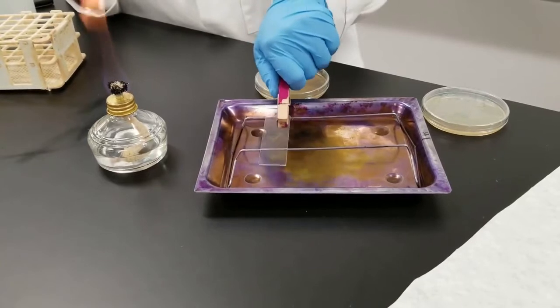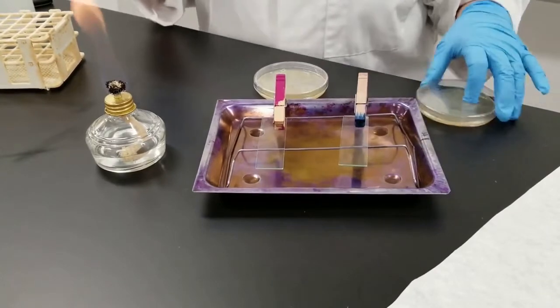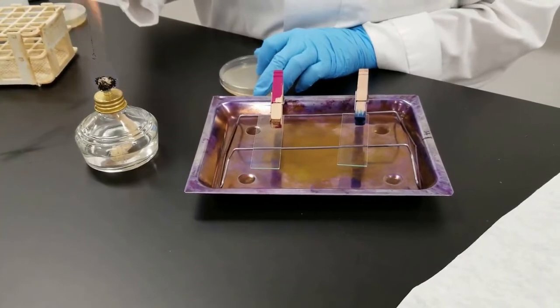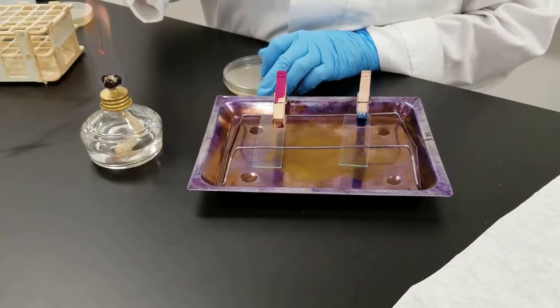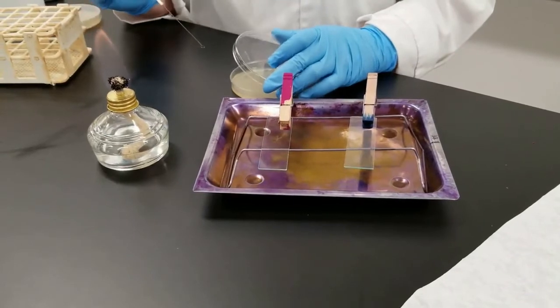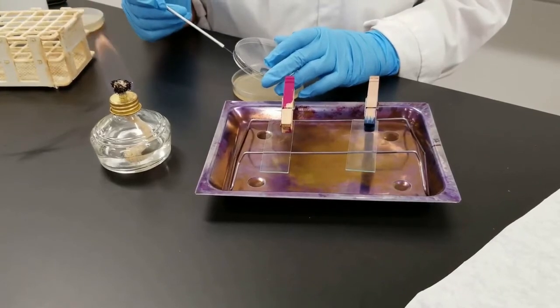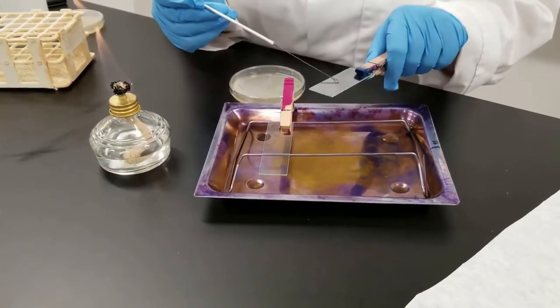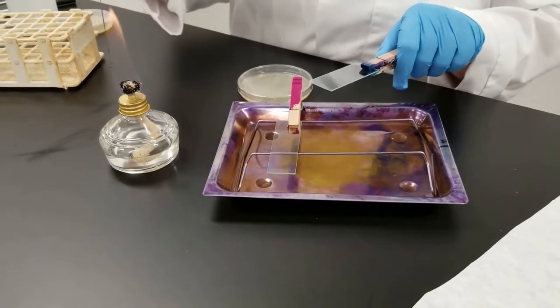I'm going to let it sit while I now prepare my second slide, which is going to be E. coli. Flame my loop. I'm taking these cultures off of a Petri dish, so I'm coming off a solid medium. You could be coming off of a test tube from a liquid medium. Remember, always be working near your flame. So now I'm taking some of the E. coli, just like I did with the Staphylococcus aureus, I'm going to smear it on here, flame my loop, and I'm done.